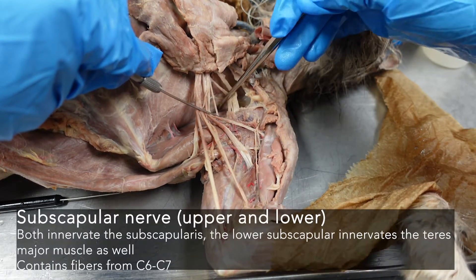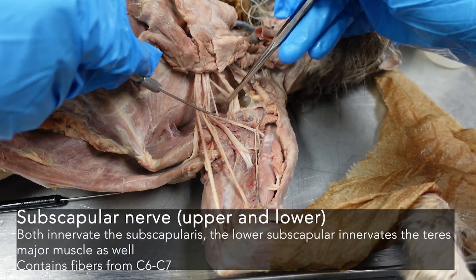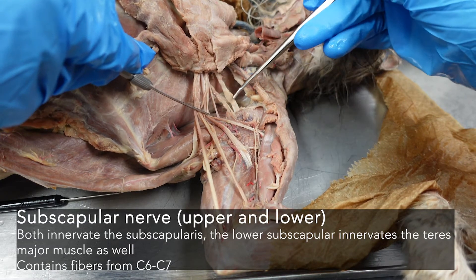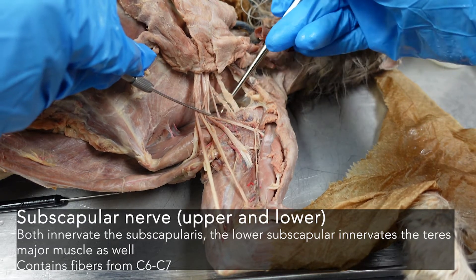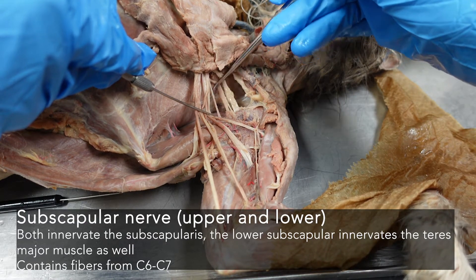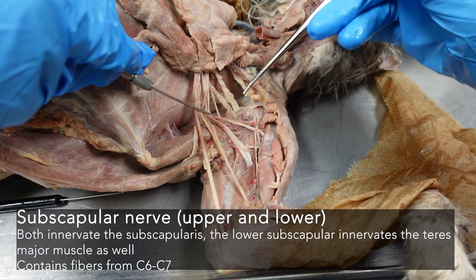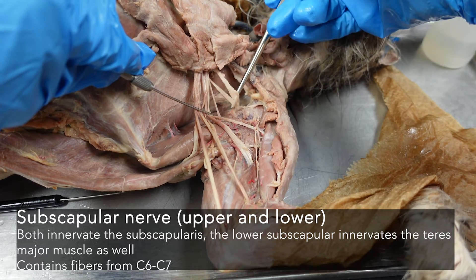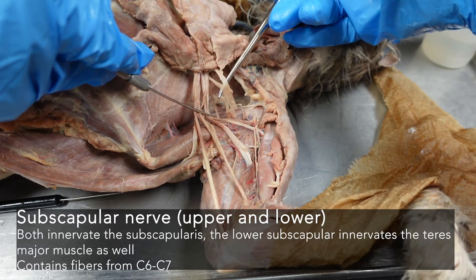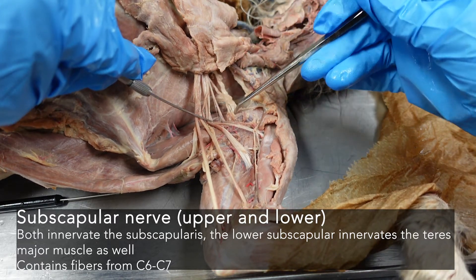The subscapular nerve in the cat is distinctly divided into two pieces, whereas in the rabbit it is sort of a sheath that descends together and then splits. In the cat, we have two subscapular nerves.